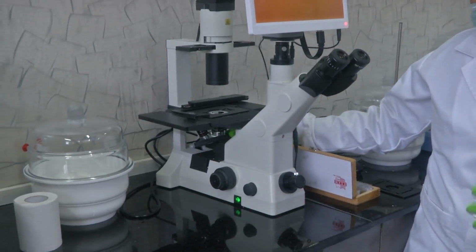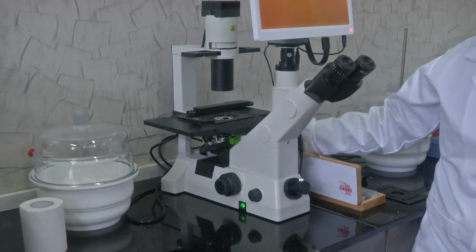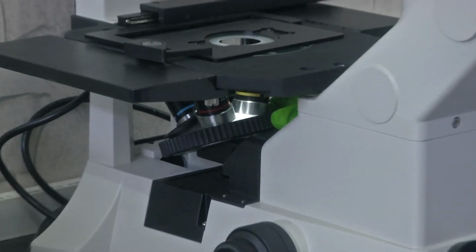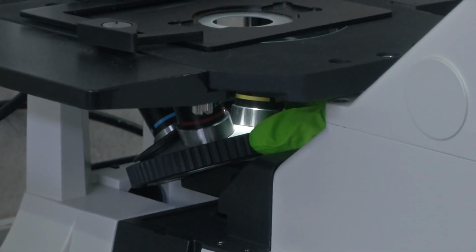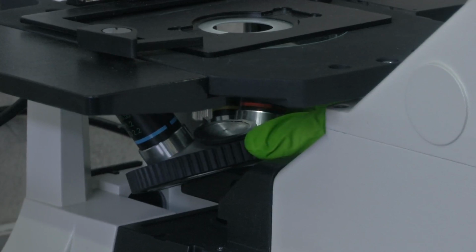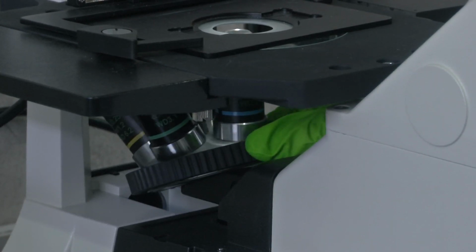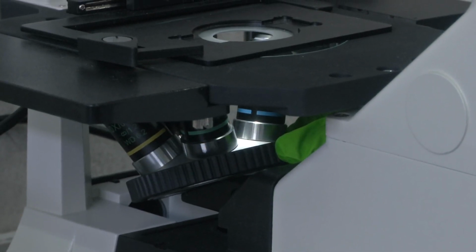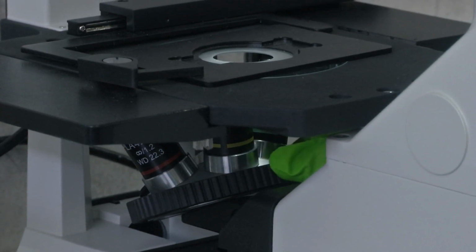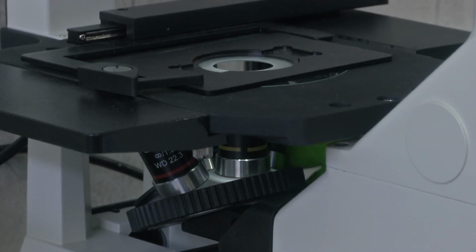A major difference between this and the regular microscope is the position, and that is why it is called an inverted microscope. Now that we have seen, just like the others, it is housed with objective lenses of different magnification. So, here we have 4x magnification, that is 1, and then another 2 which is 40x magnification, and then 3 which is 20x magnification, and then the fourth one which is 10x magnification. So, each of these with the required working distance can be set depending on your use.